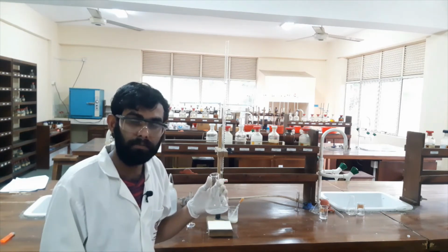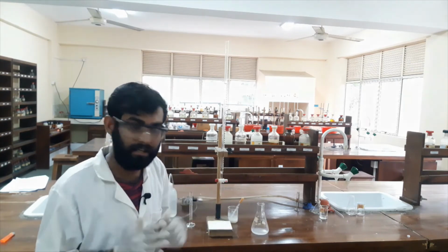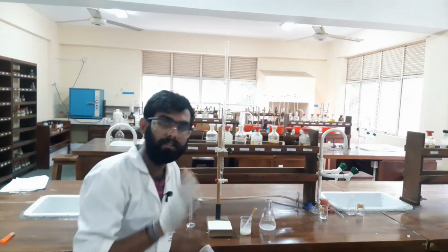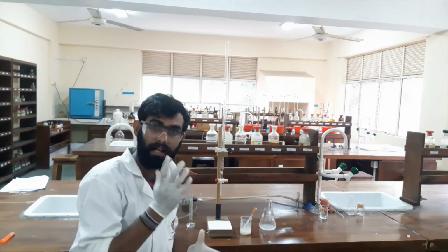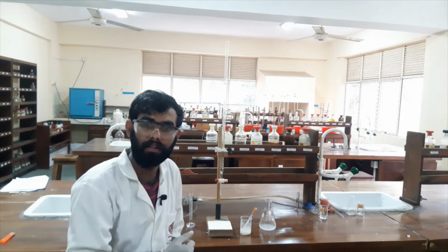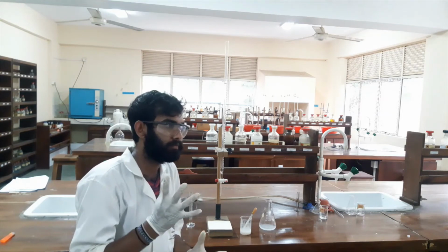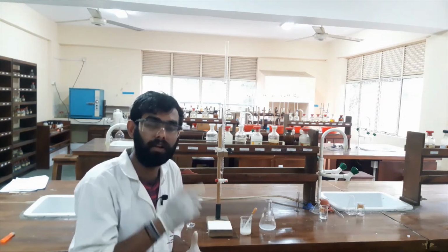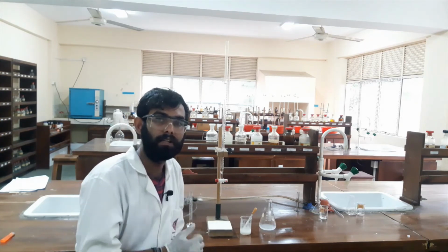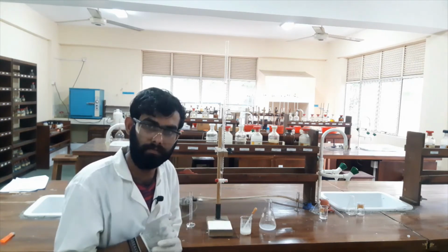So after the reaction was complete, I started the titration, but initially I didn't add any indicator. Here we are using starch as the indicator. The important thing is when starch reacts with iodine, starch has two structures, amylose and amylopectin. Okay. So these amylose molecules have coil structures. Iodine goes into this coil and produces a complex known as the starch iodine complex, which is blue in color.